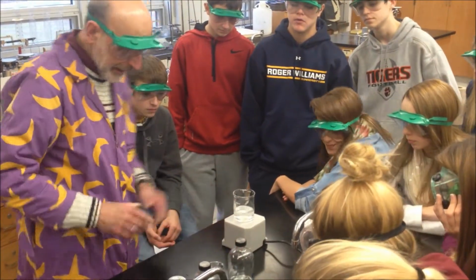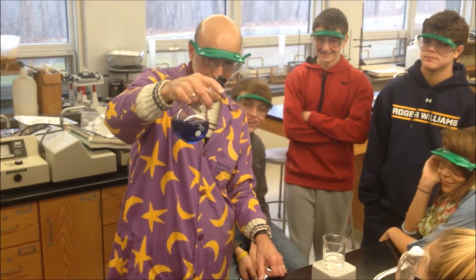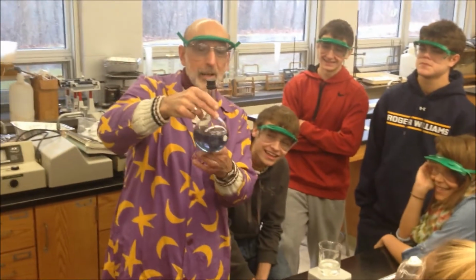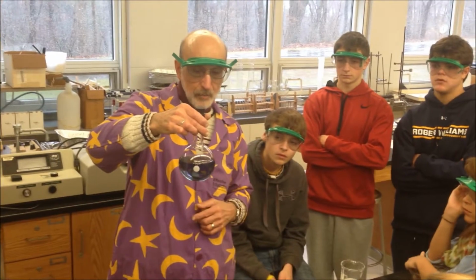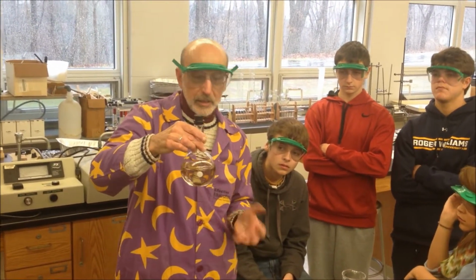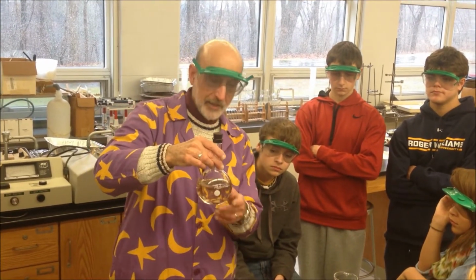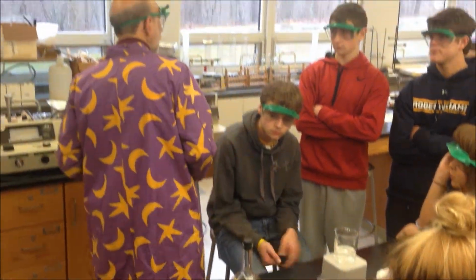Now, the second one. Whoa! Magic. Okay, but it changes back. This is something you have to make up fresh because by the end of the day it's just done, so hopefully it'll last through G block. Again, I saw these in high school. This stuff is interesting.